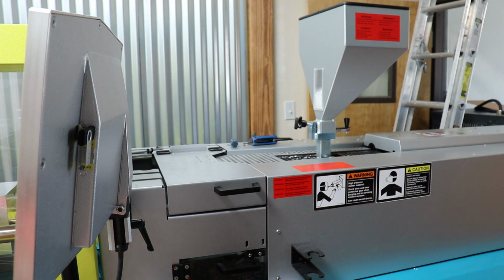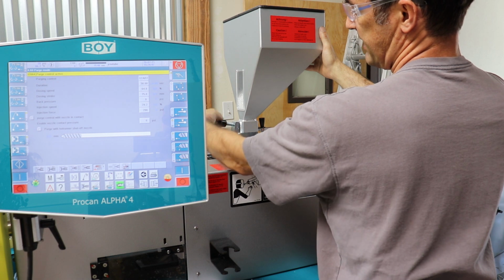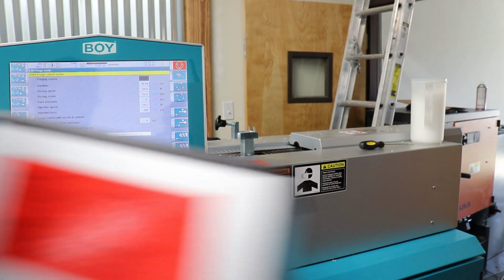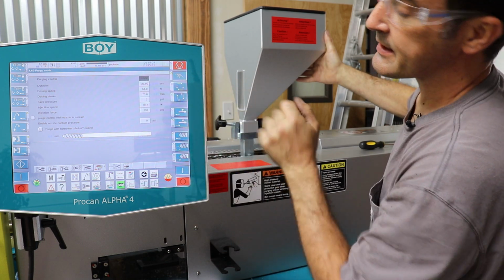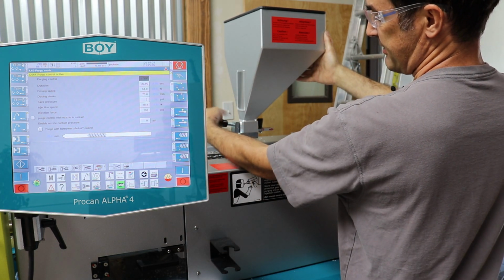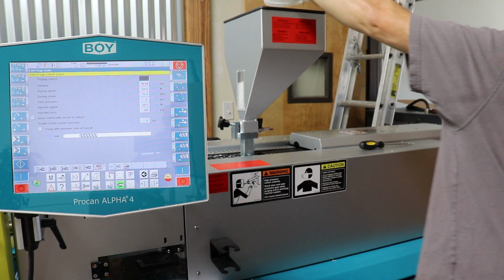We'll do this a few more times. So I'm going to pull this hopper off again and then get it ready to stick the new stuff in. I'll hit the purge again. All right, so we're back. Get this guy back on. I'll just keep hitting this guy because there's still plastic down in the injection unit that we want to clean out. And then this guy is still closed, so I can go ahead and load our new plastic.